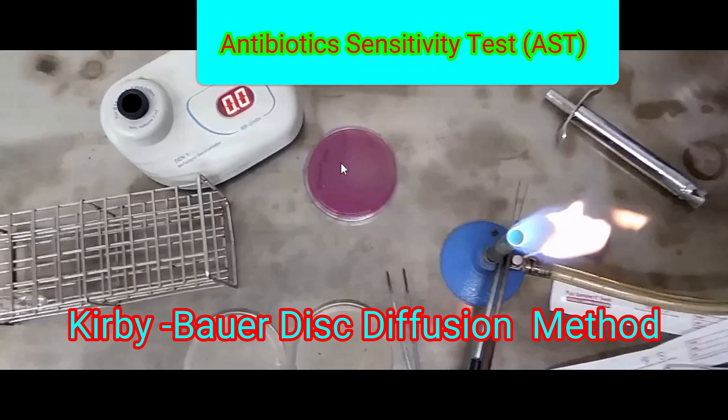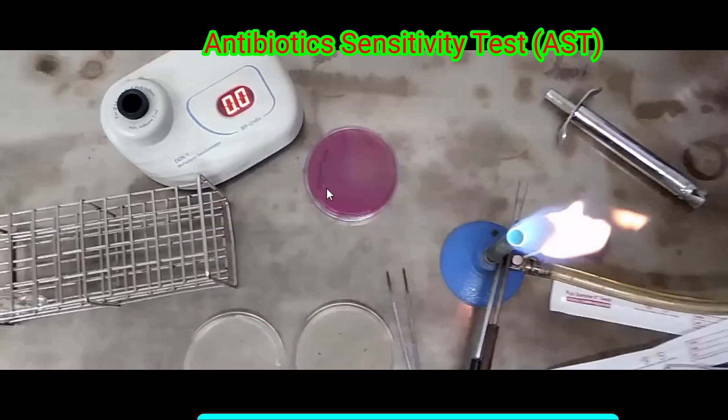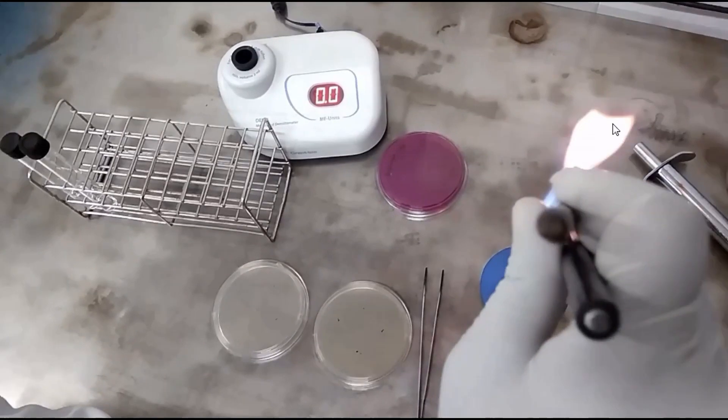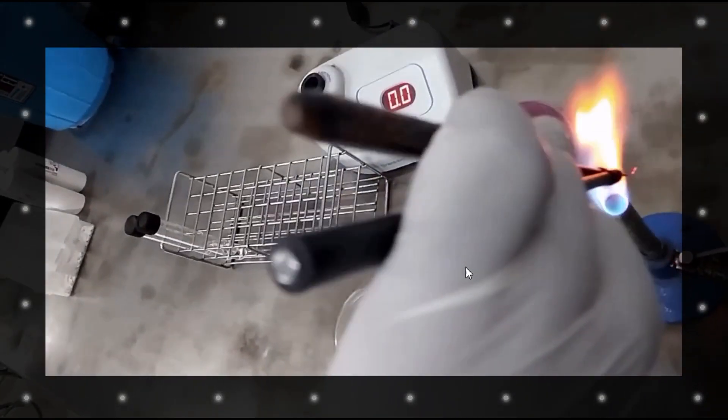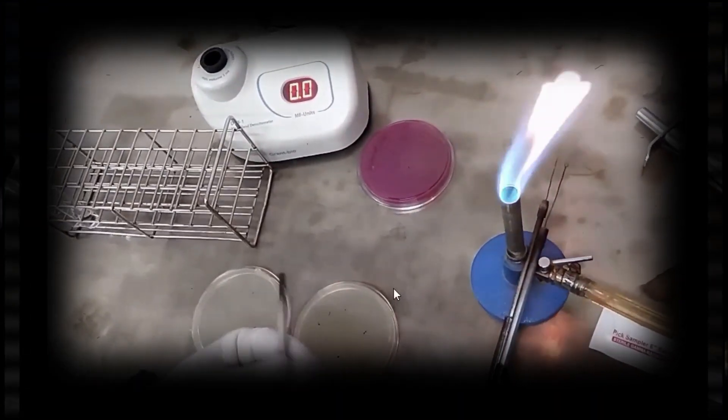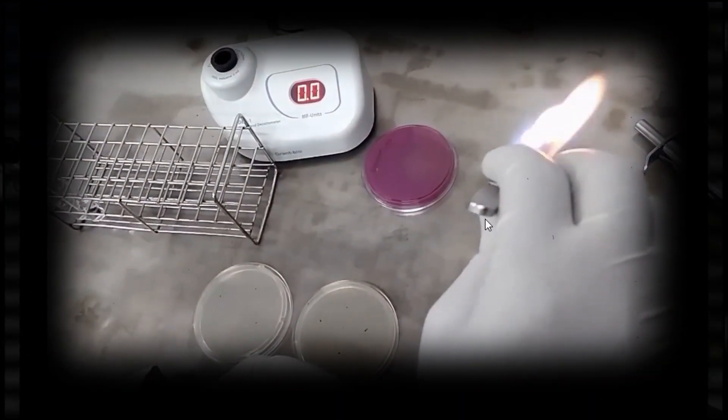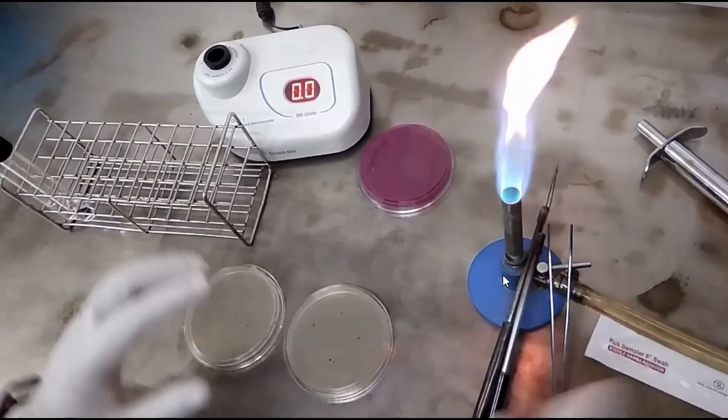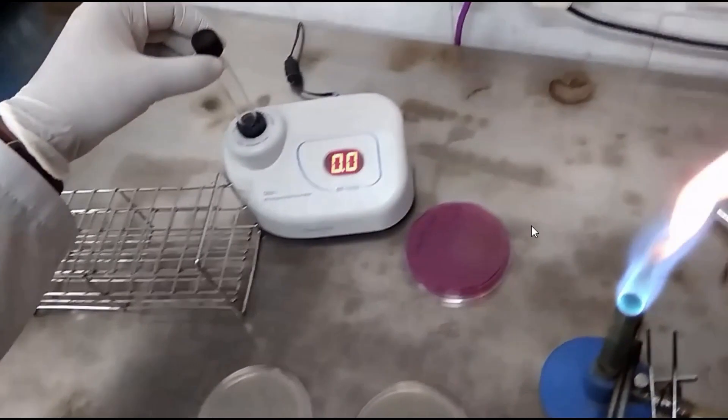Hi, today we are going to perform an antibiotic sensitivity test using the most common Kirby-Bauer disk diffusion method. Requirements: here we can see Mueller-Hinton agar plates, Bunsen burner, forceps, inoculating loop, test organism, and McFarland densitometer.